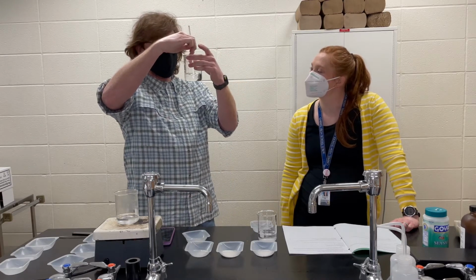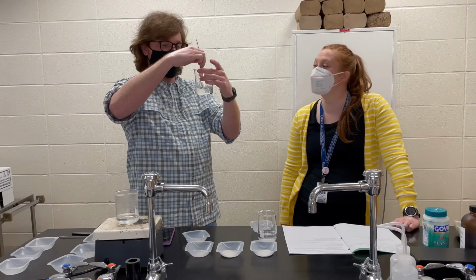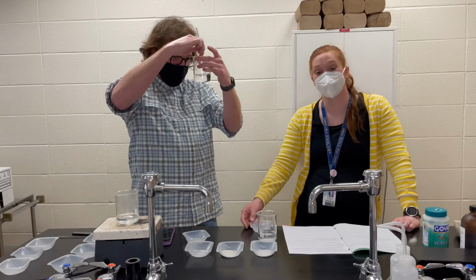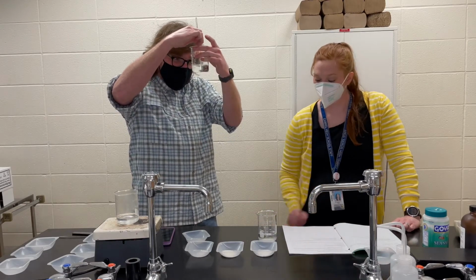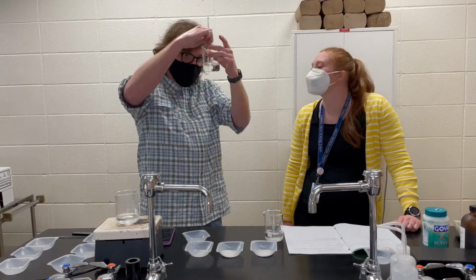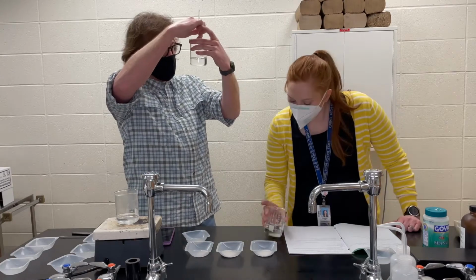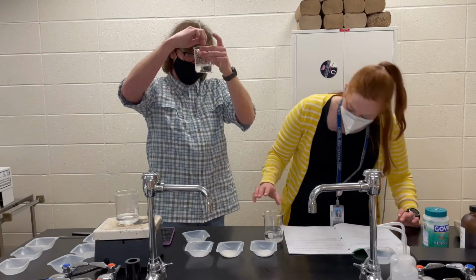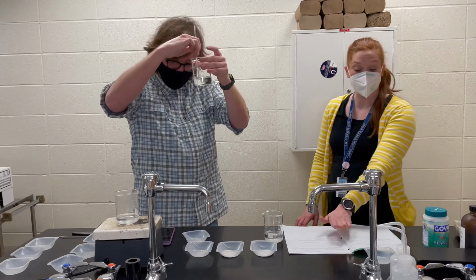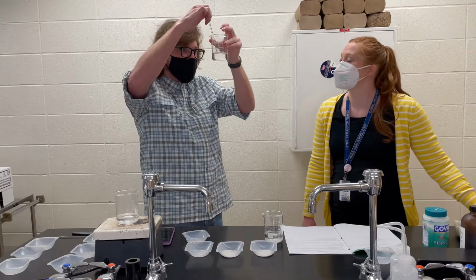Feel free to sit back and relax. Yeah. Enjoy the ASMR of glass lightly scratching glass. And salt hanging out in a beaker of water. It's just hanging out there. Really exciting. Now, I do have my data sheet here because we are going to be recording our data so we can help you out at home to record those data points.